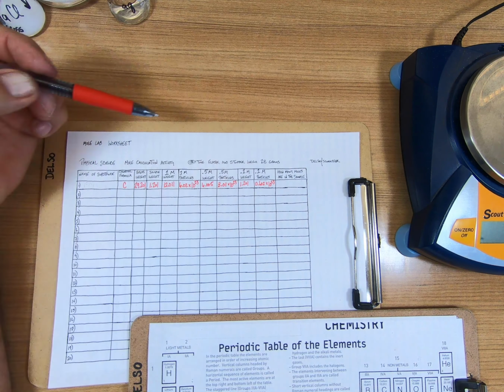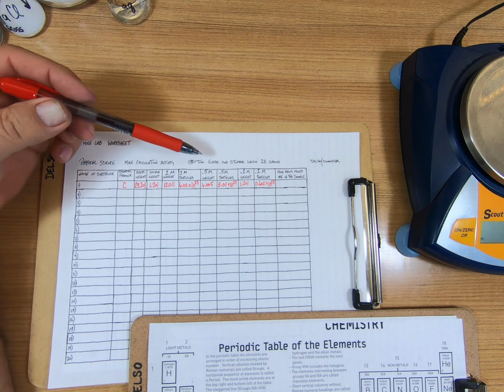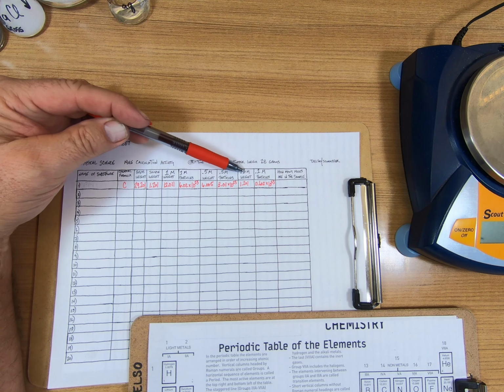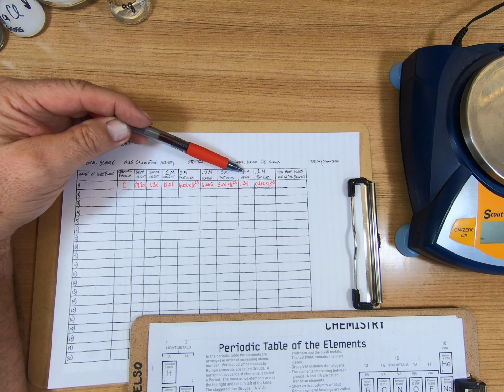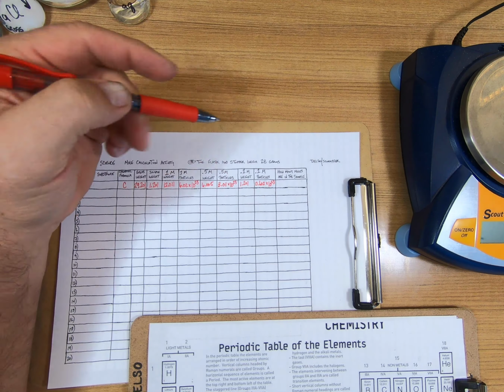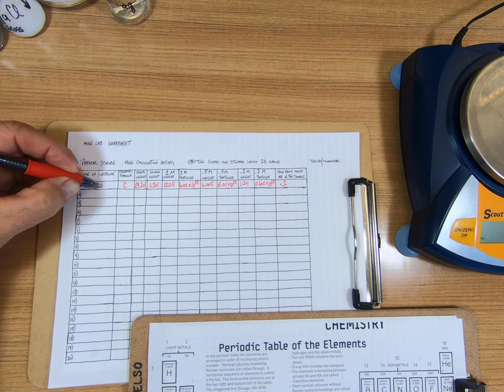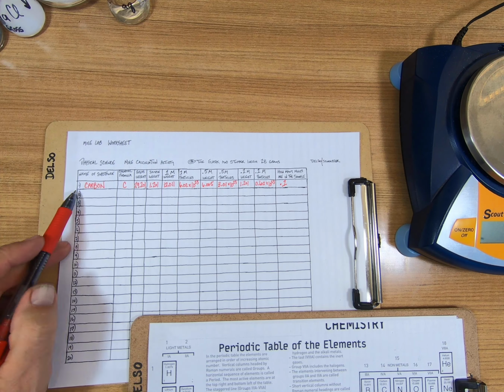How many moles are in the sample? Here's your sample, 1.201. It's going to match one of these three numbers, either the 1 mole weight, the half mole weight, or the 0.1 or 10th mole weight. In this case, it matches the 0.1 mole weight, so how many moles are in the sample? 0.1. You're going to do that for each one of these. Some hints. The name of the substance from the periodic table is carbon. We'll put that over here. And we're done with carbon.